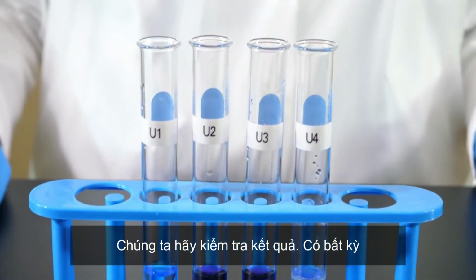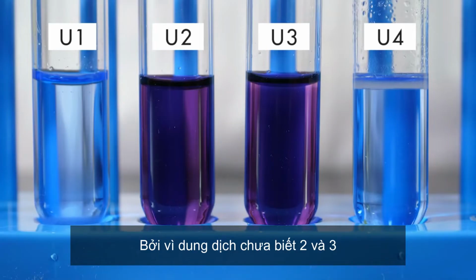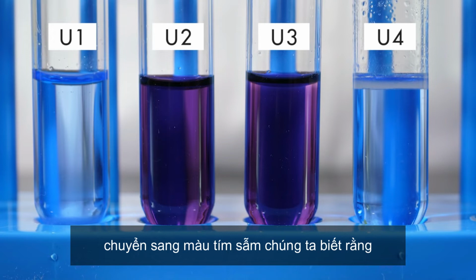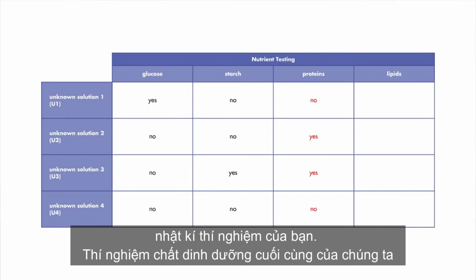Let's examine the results. Did any of the solutions turn dark purple? Since unknown solution 2 and unknown solution 3 both turn dark purple, we know that proteins are present in both solutions. Since neither of the other 2 unknown solutions turned dark purple, we know that proteins are not present in those solutions. Record your observations in your lab journal.